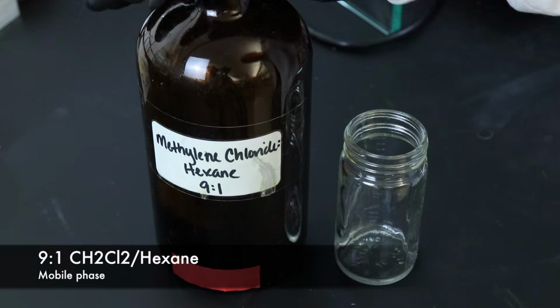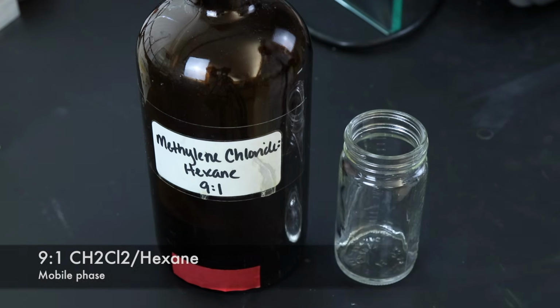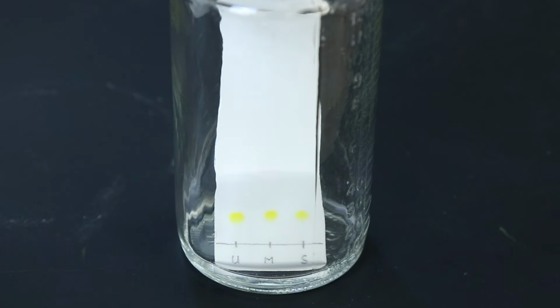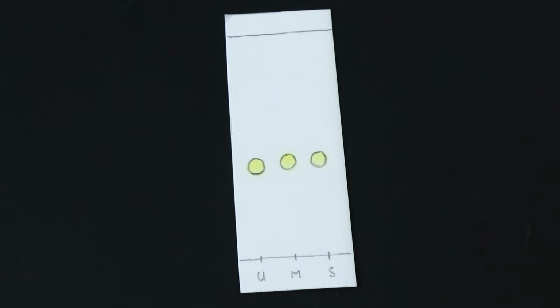I'll use the 9:1 methylene chloride hexane solution as the mobile phase, and as the TLC plate develops, we can see that the spots are moving pretty closely together, so that's a good sign, but we'll wait till it's fully developed to decide whether or not we guessed right. Once it's done, it does look like there was only one compound per each spot, and they seem to have the same Rf value, so it looks like cyclopentanone was a pretty good guess.